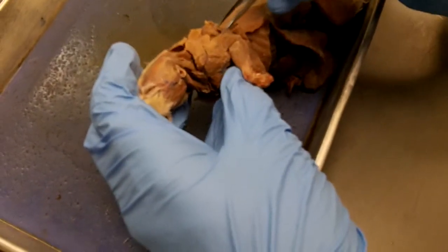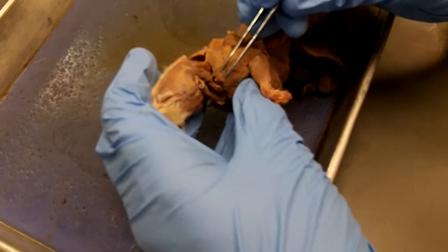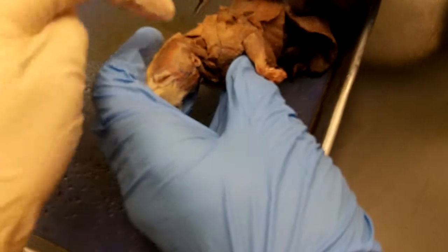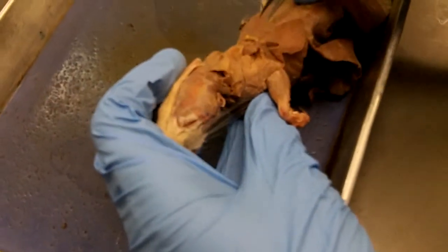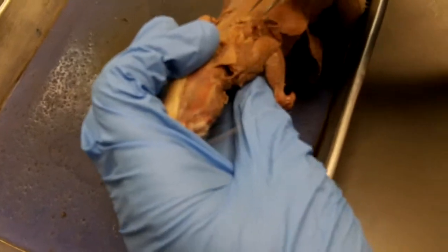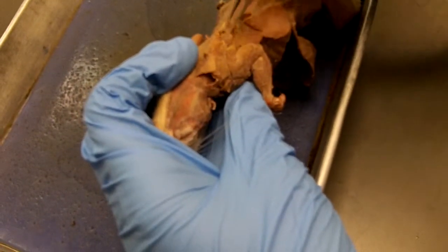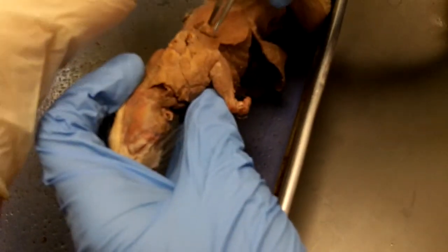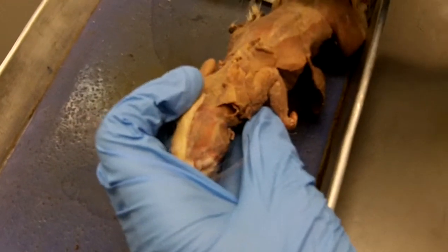Now, when we look at the lateral surface, here's your... We have this one is called omotransversarius. This one right here, the whole entire, this is all one right here. That's all cervical trapezius. And then there was a thoracic trapezius, which is a strap-like one that came back like that. And then the latissimus dorsi is a great big huge triangular one that's below that and behind that.